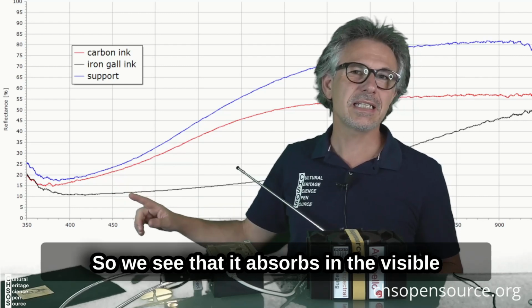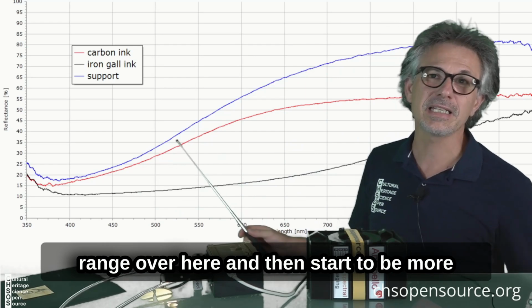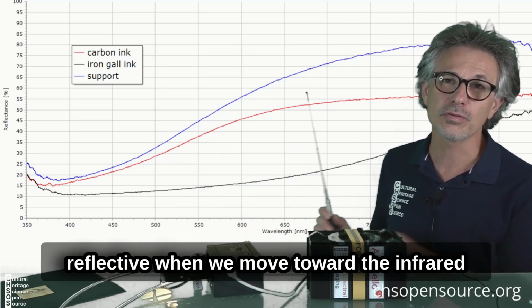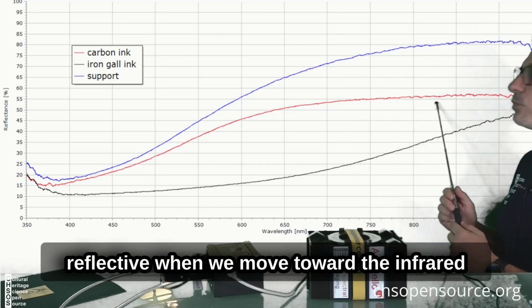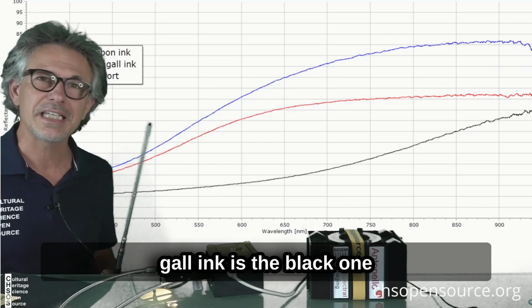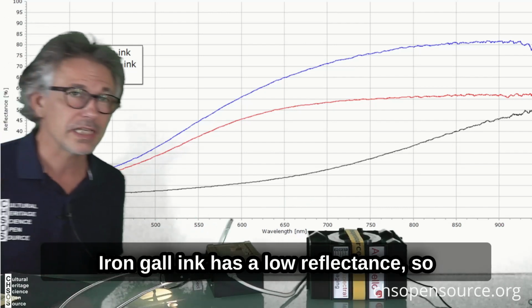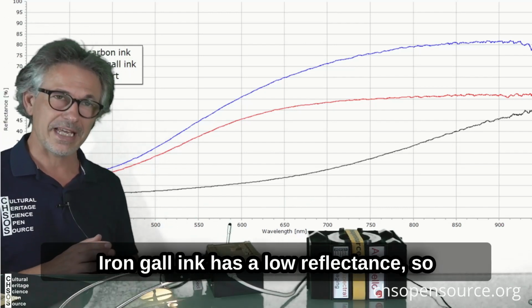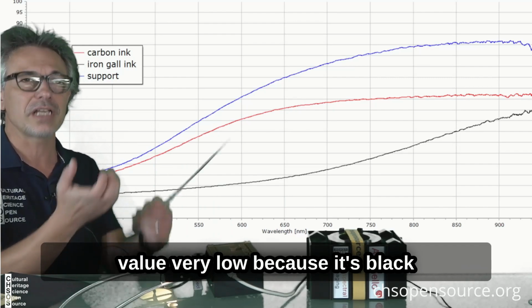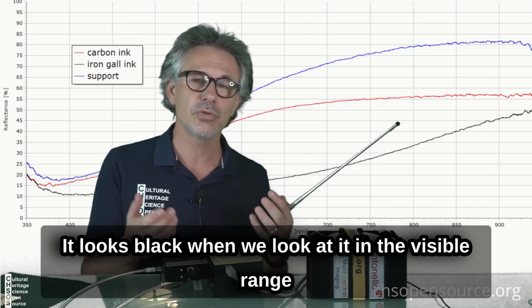So we see that it absorbs in the visible range over here, and then starts to be more reflective when we move toward the infrared. On the other hand, we have iron gall ink, the black one, over here. Iron gall ink has a low reflectance, a very low value, because it looks black when we look at it in the visible range.